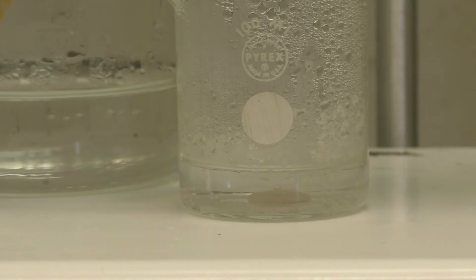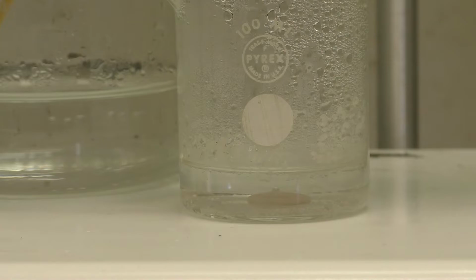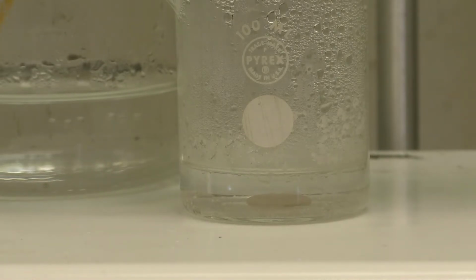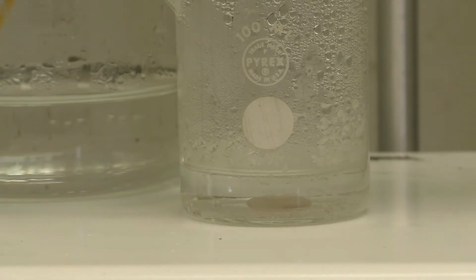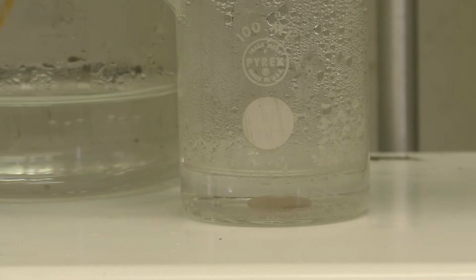We've put this back on the hot plate and let it warm up quite a bit. The solution's re-clarified, as you can see. Unfortunately, we haven't managed to get rid of all of the oily material. There's still an oil droplet there in the middle that you can see. However, we seem to have gotten the material much more soluble, and we may just have to attempt the recrystallization still with a little bit of this oily material here.